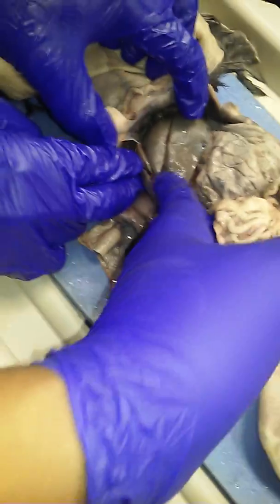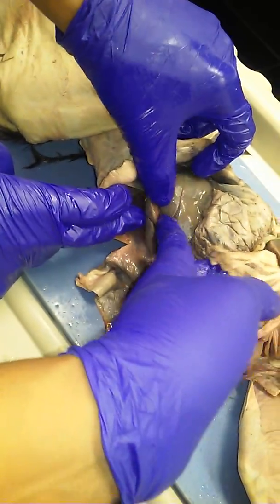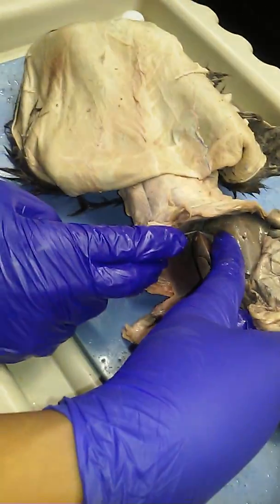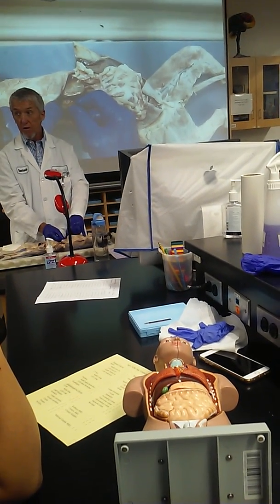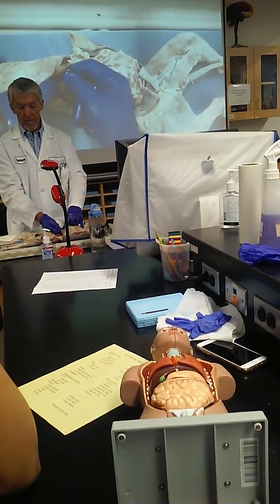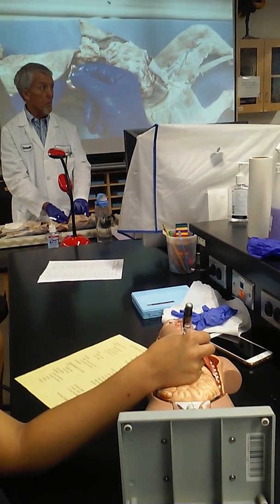because they're side by side. They're not above and below. They're not in front and back. They're side by side: medial and lateral. So watch me name the 4. Right lateral lobe of the liver. Right medial lobe of the liver. Jump over to the left side. Left medial lobe of the liver. And left lateral lobe of the liver.